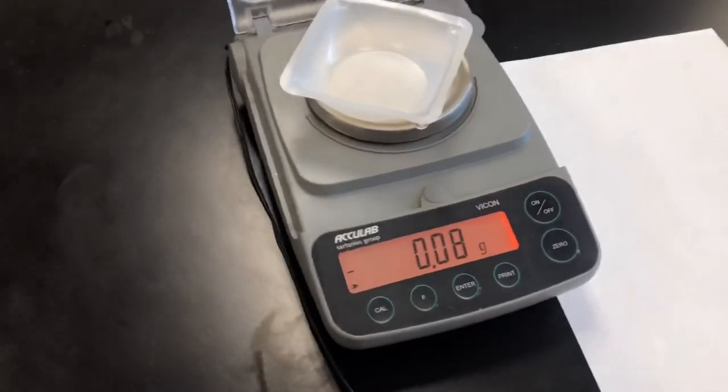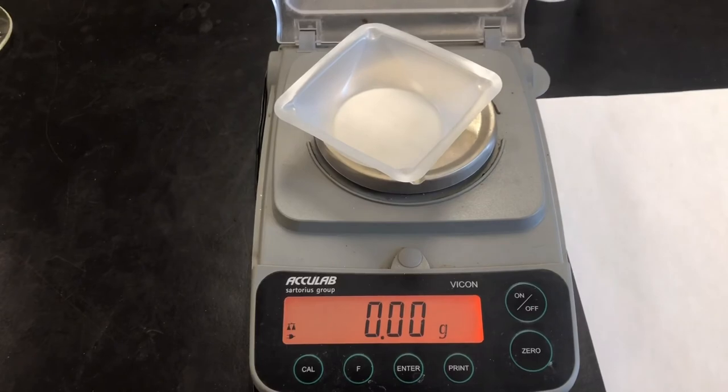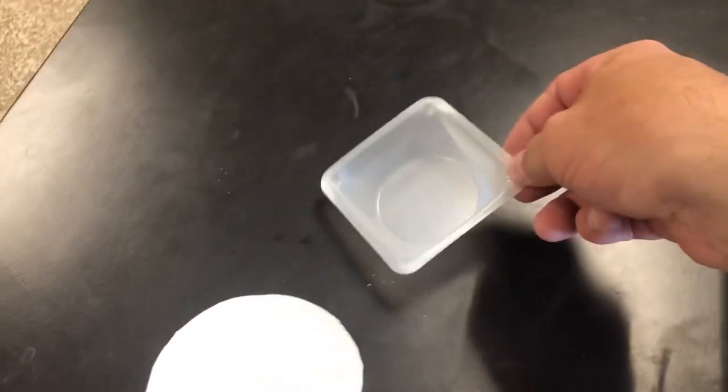We are going to place this into our weighing dish. I will transfer that material.